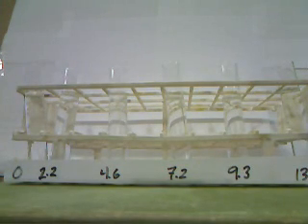We'll now try the indicator known as crystal violet in each of our 6 solutions.